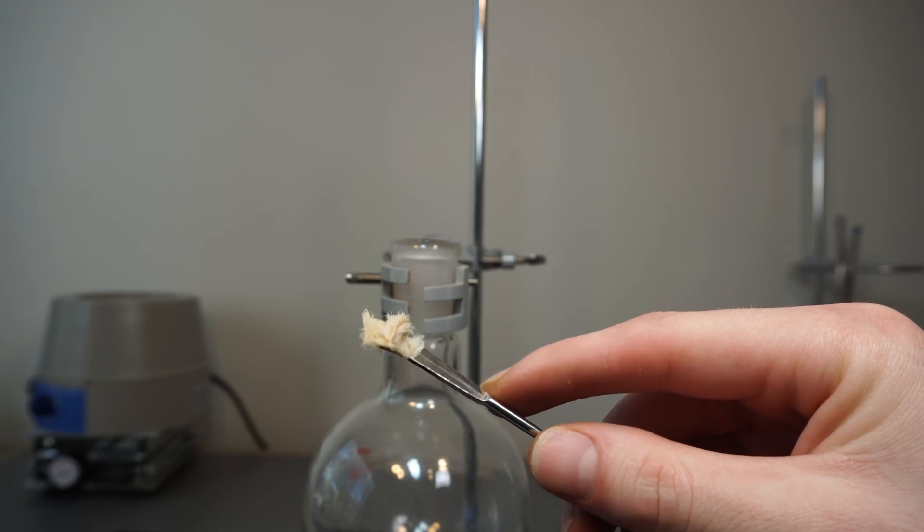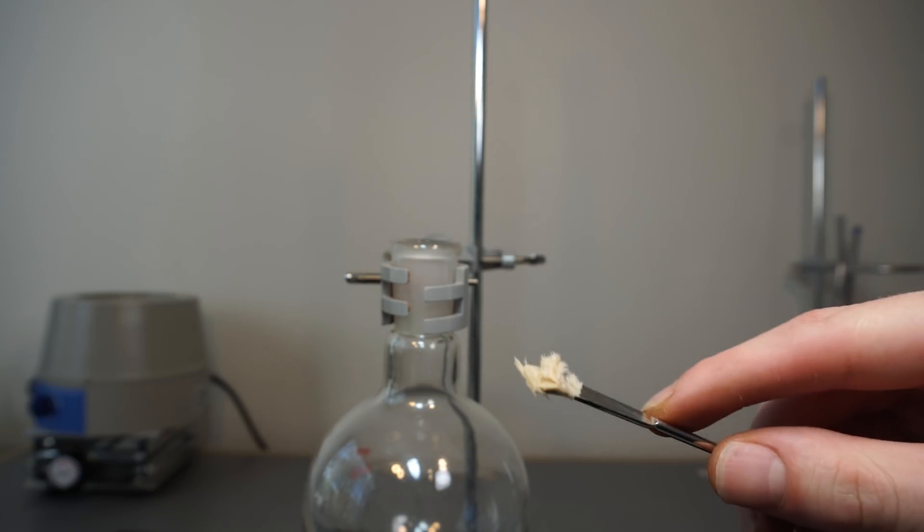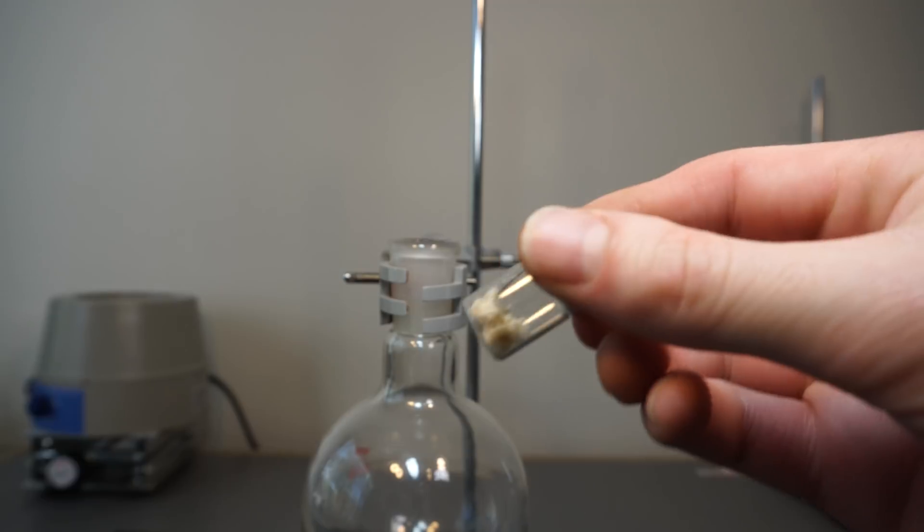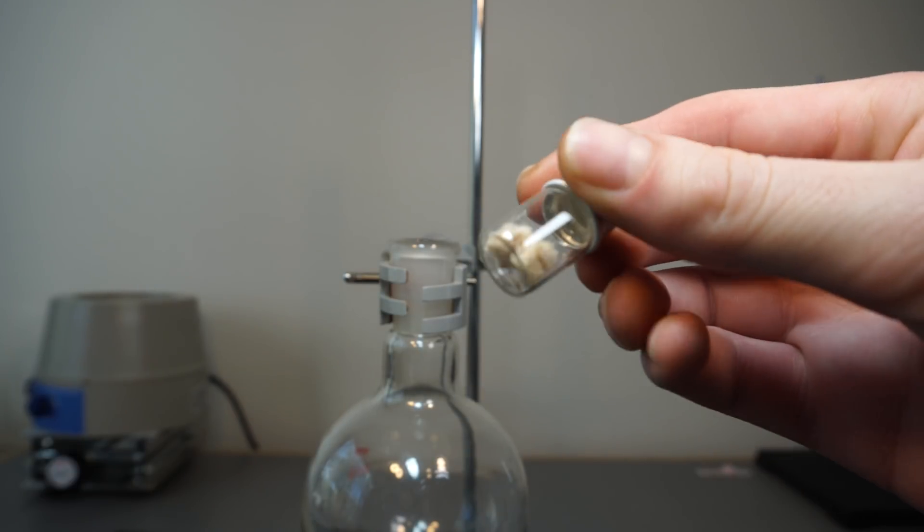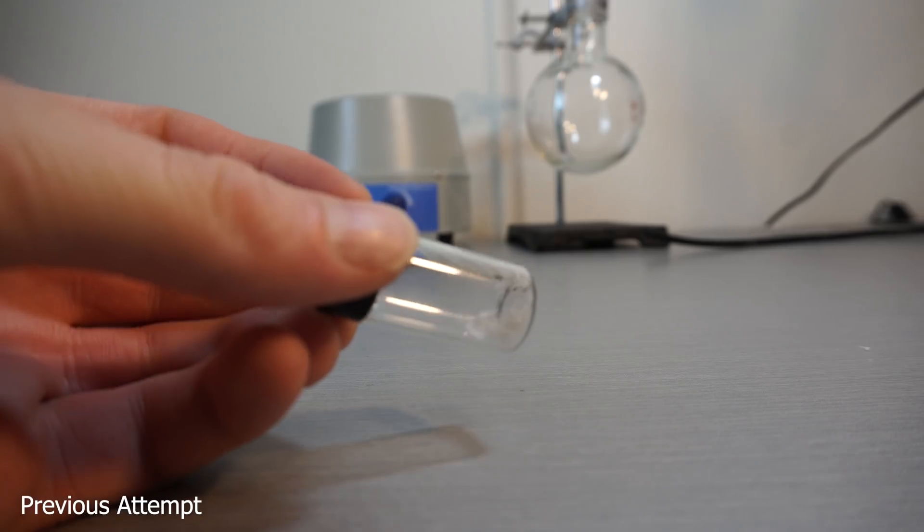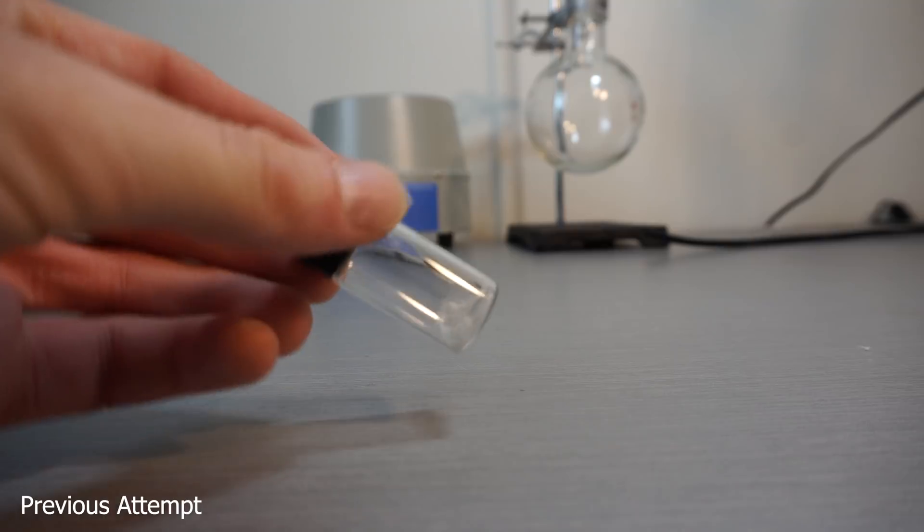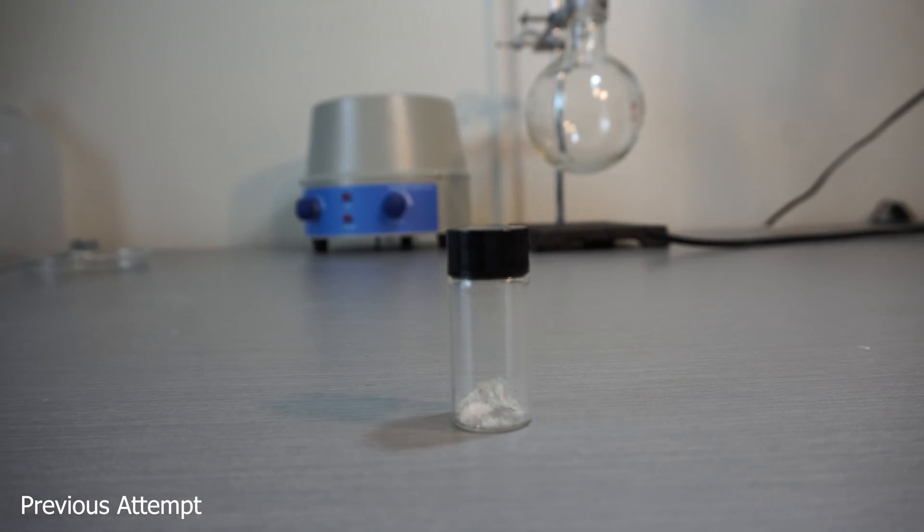In the end, I got about 0.8g of pretty pure caffeine, though it obviously isn't super pure. However, I have run this a few times, most being general failures. On one attempt I did get super white caffeine, though nowhere near the yield I got this time. I took some microscope shots for viewing gratification.